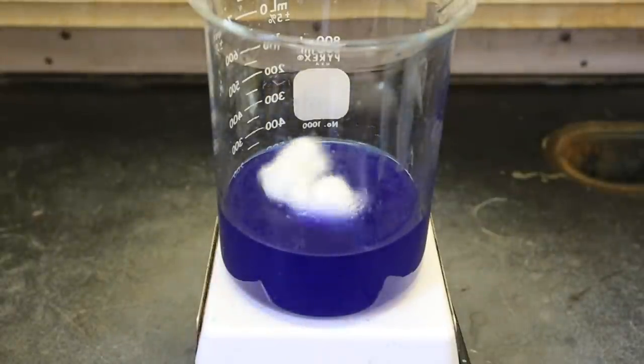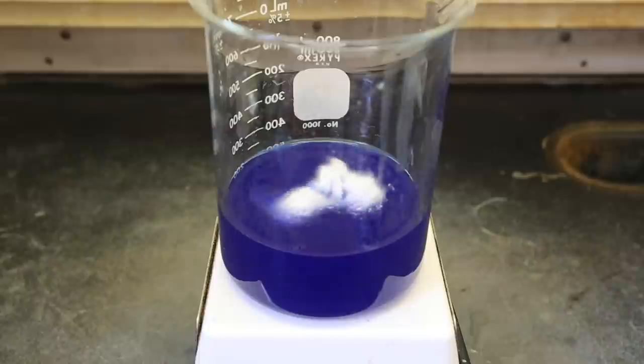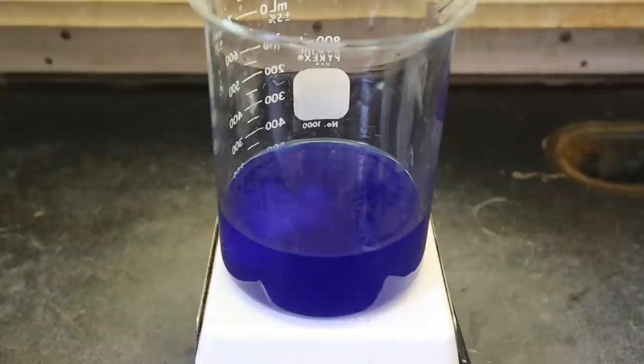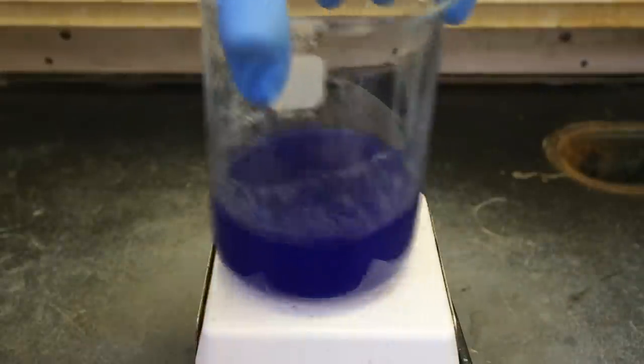This solution is actually from a separate replicate. I am including it to show you that the colors are not always consistent. You do not need to worry as long as the color of your reagent is on the range between dark blue-purple to black. After completing this experiment several times, I found that the colors of the solutions were quite variable, but each time the reagent worked just as well.